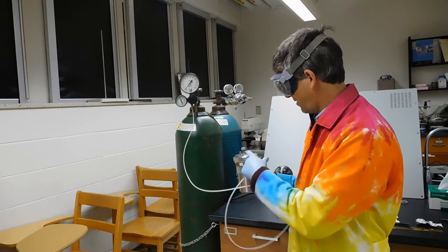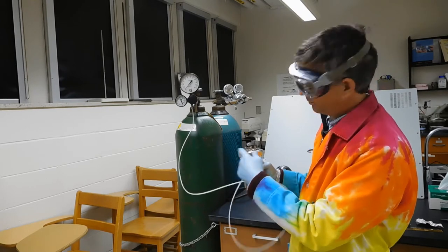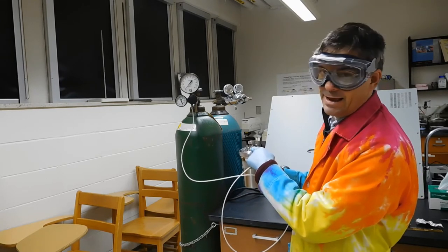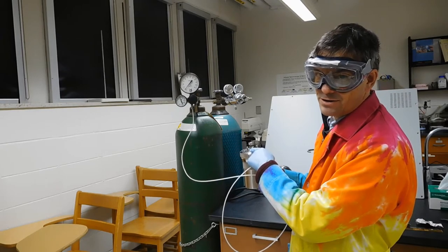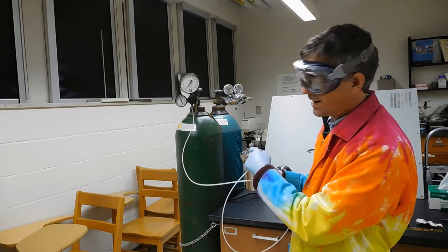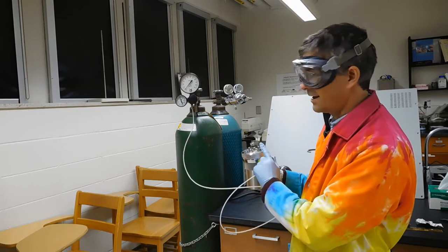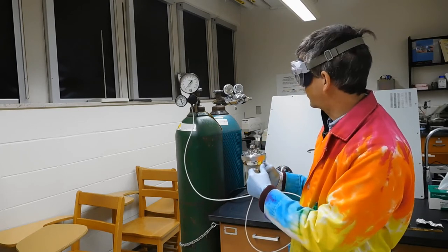Now, if that were all that were there, it would come right back out. But there's a valve in there, just like the valves on your car tire or bicycle tire stems, there's a one-way valve, so the gas can only go in. If it tries to come back out, it seals the valve shut.